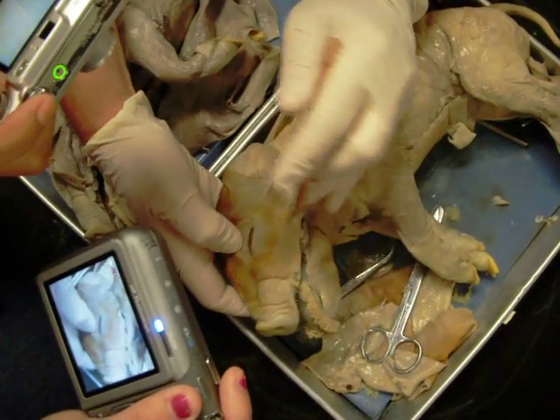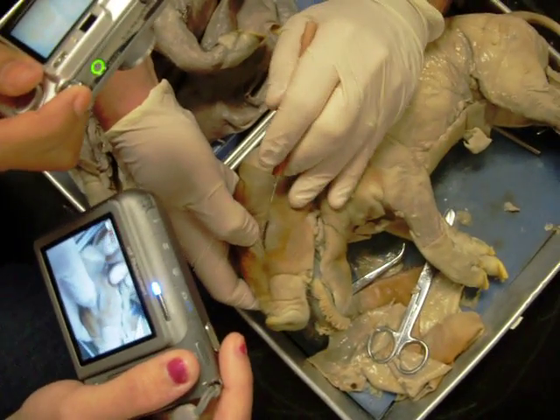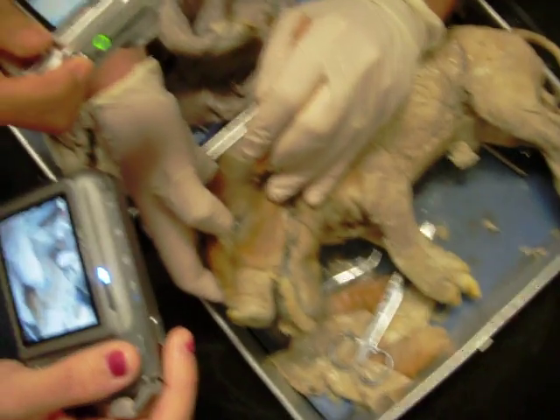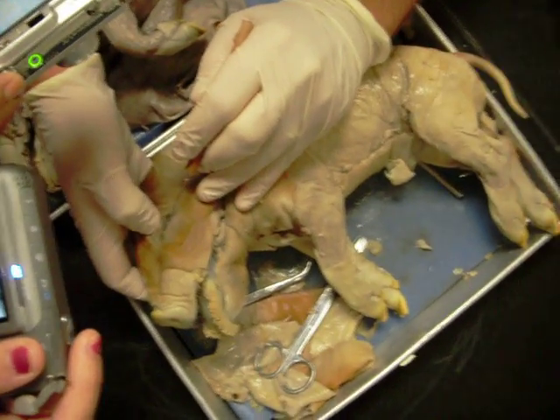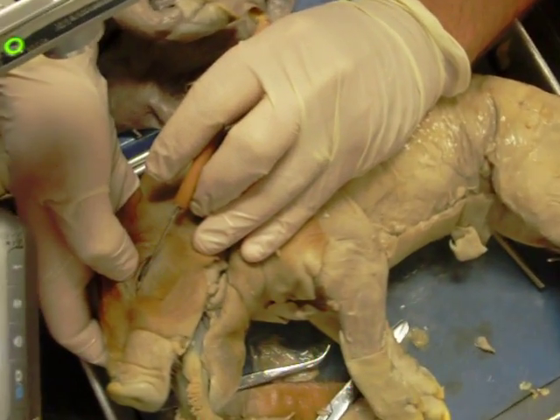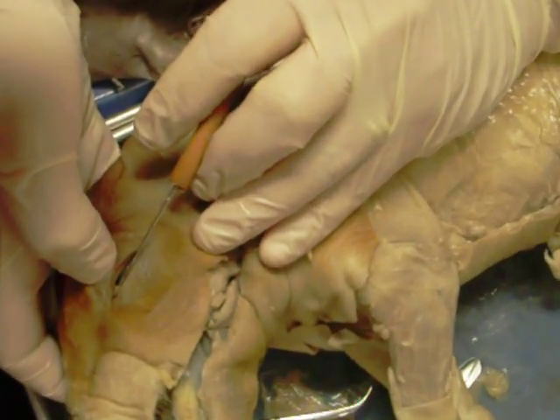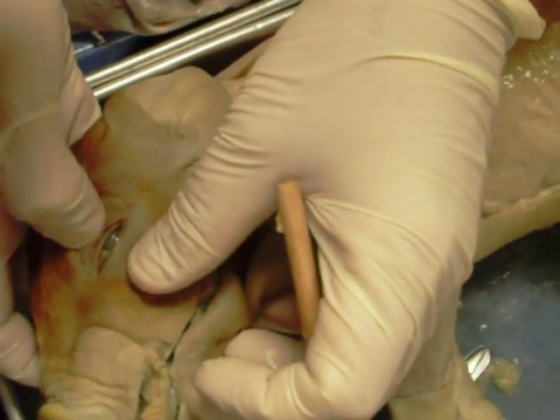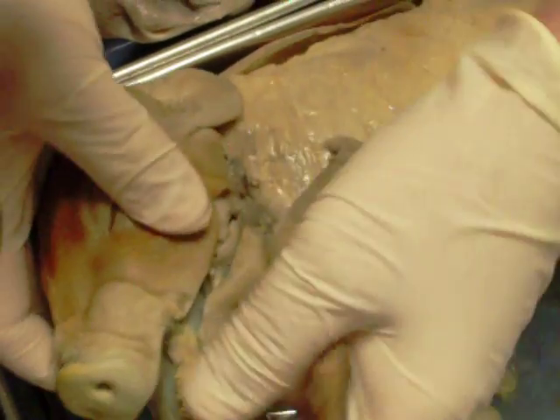If we open up the eye on the medial surface, we can see right there — I'm going to go ahead and hook it. That membrane I've hooked right there is a nictitating membrane. Let's open it up so you can see a little bit there.